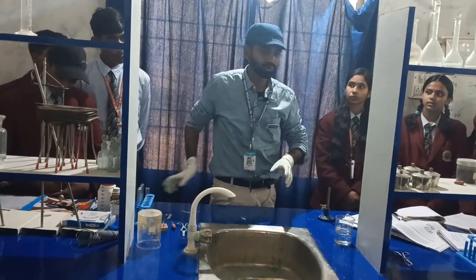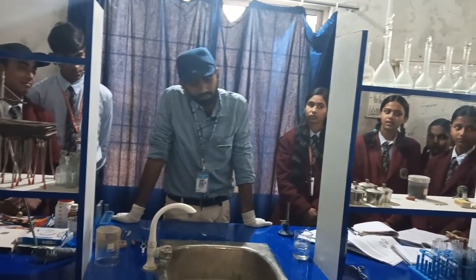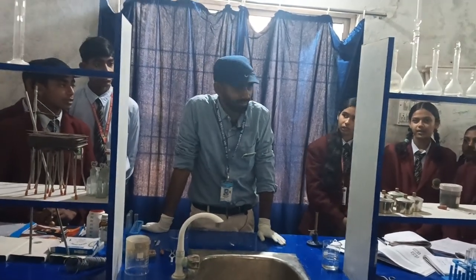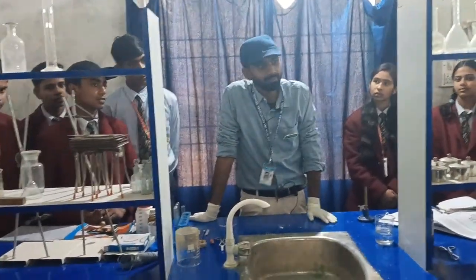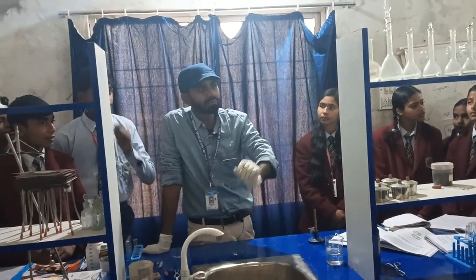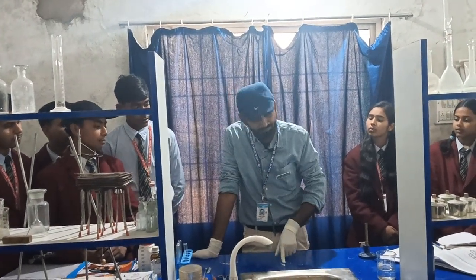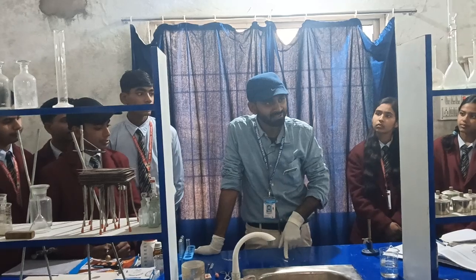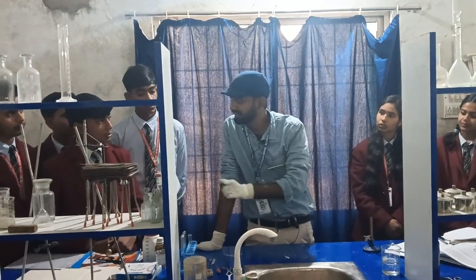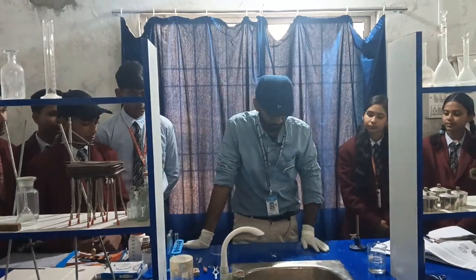To explain what we understood from this experiment: it was a chemical reaction and an exothermic reaction. We got a new product. First, we got magnesium oxide. Then, when we added water, we got magnesium hydroxide. The nature of magnesium hydroxide is basic, which is why phenolphthalein turned pink.